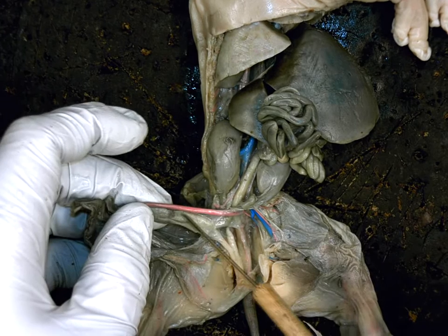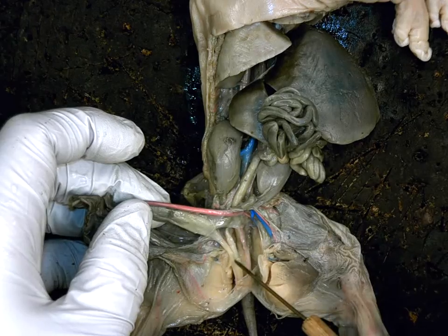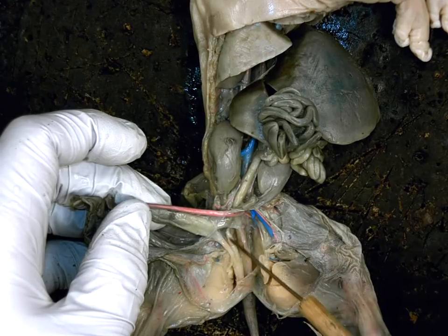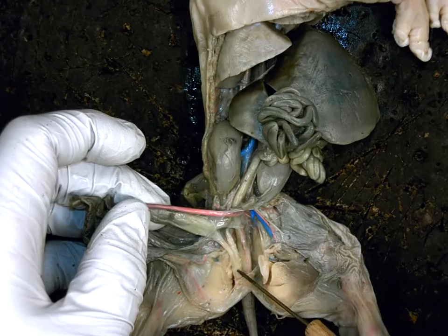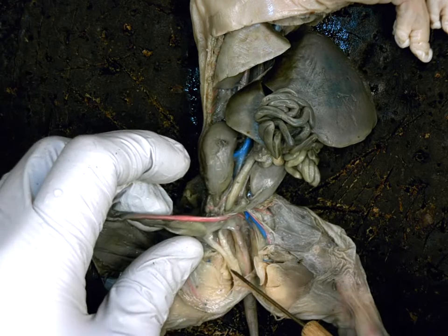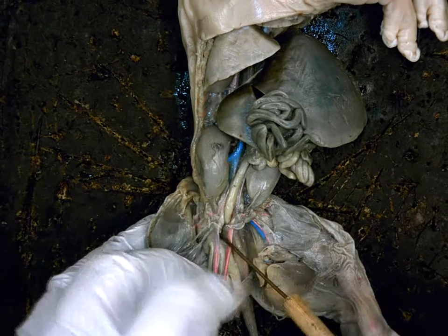Now, here is the bladder draining to the urethra. This is the uterus. You'll see they unite, which means what is this passageway? That's the female what? It's part of the reproductive system. Under the uterus is the what? The vagina, which is the site of copulation. Okay? So it's her copulatory organ. Does that make sense? So ovaries to oviducts, coil down to the uterus.